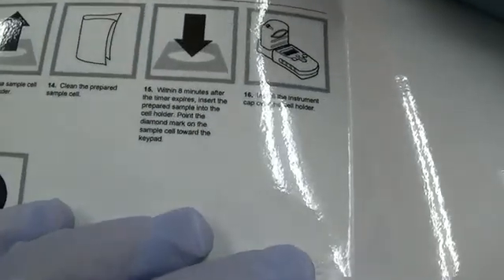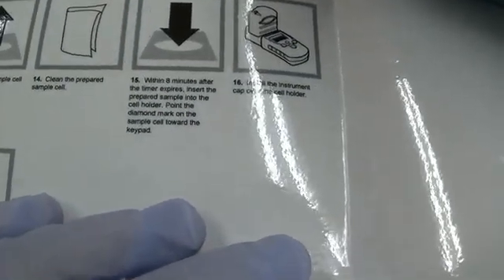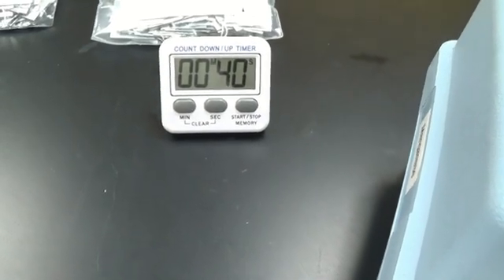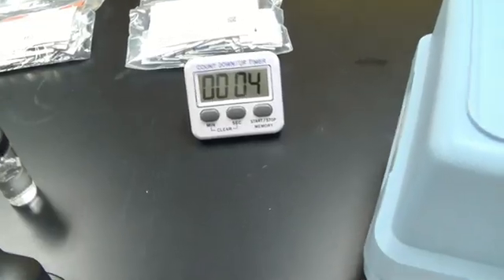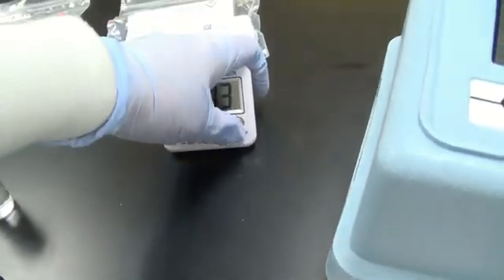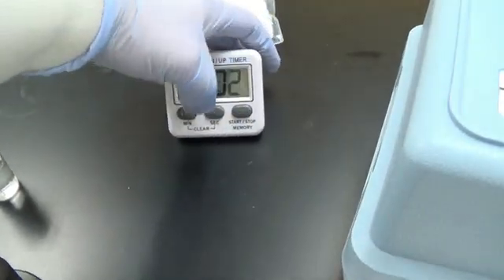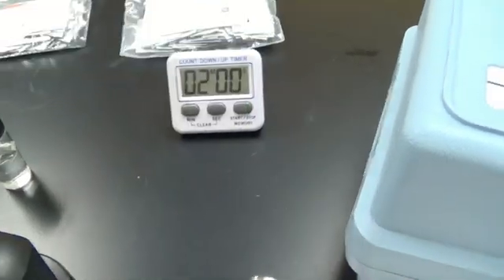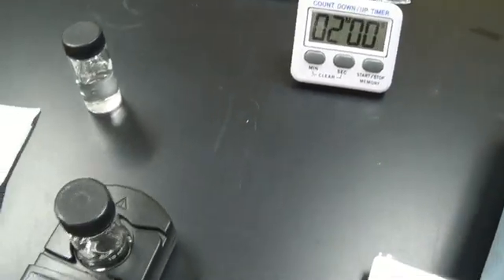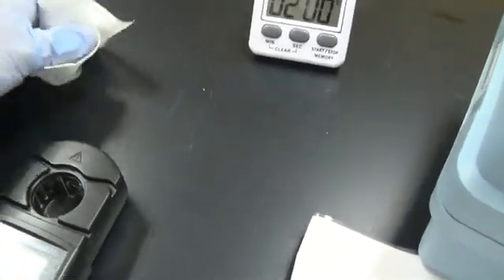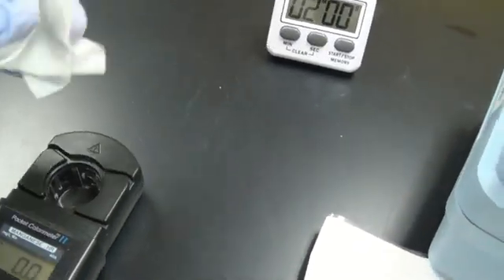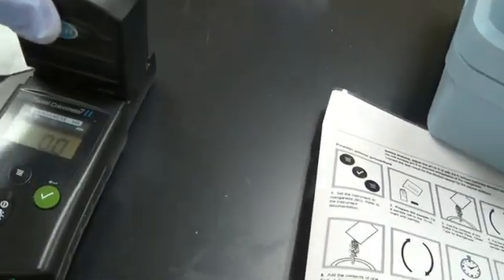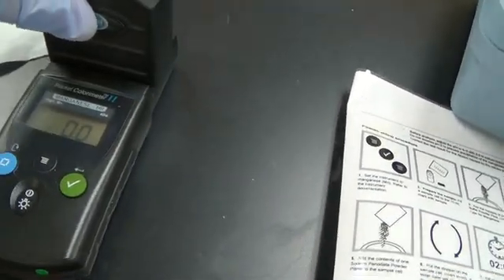Next, we're going to remove it and we're going to clean the prepared sample after the two-minute wait. All right, we are set. I'm going to remove the blank. Take the blank out. Take the sample, wipe it, put it in facing forward. Take the reading.